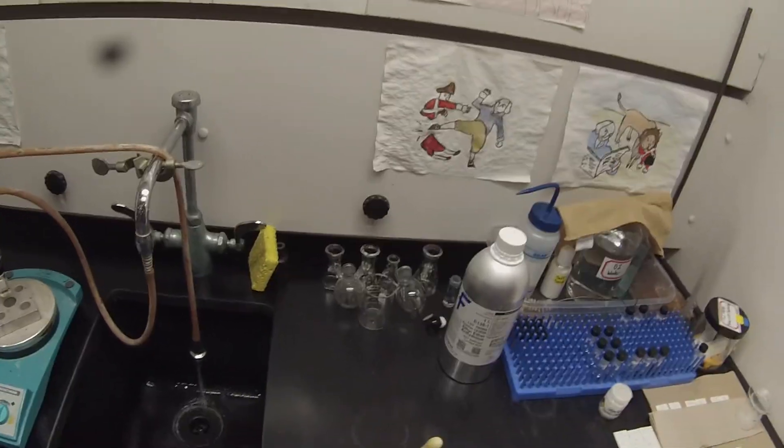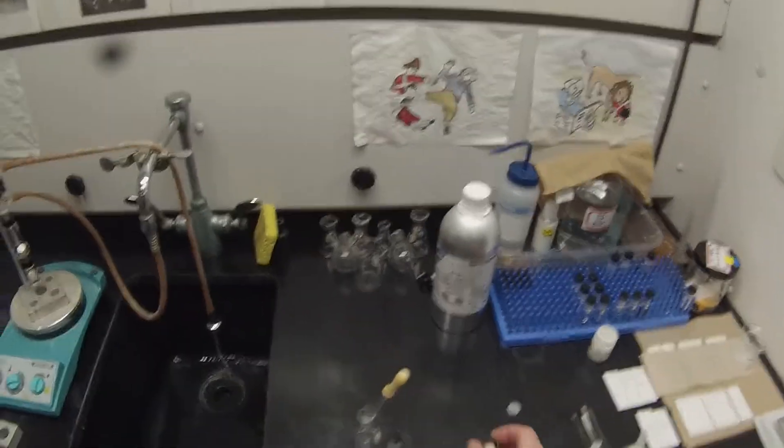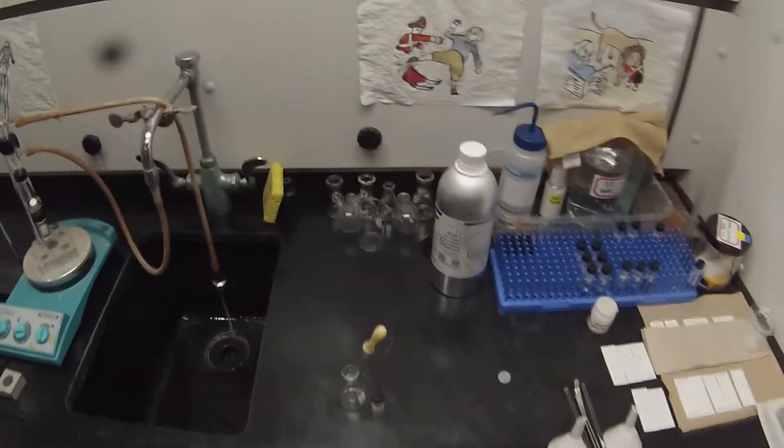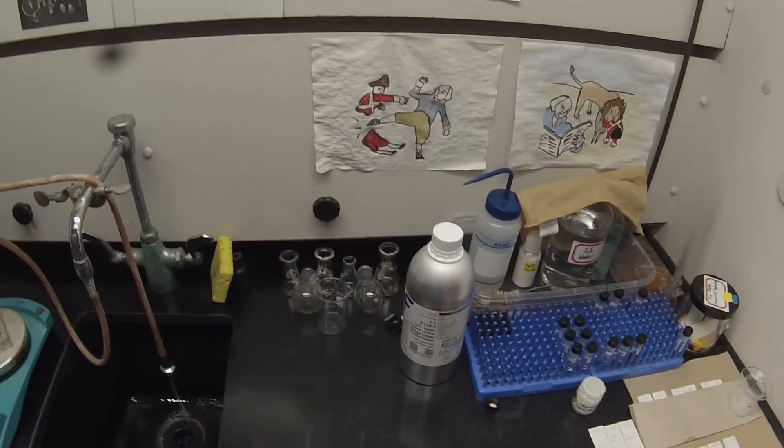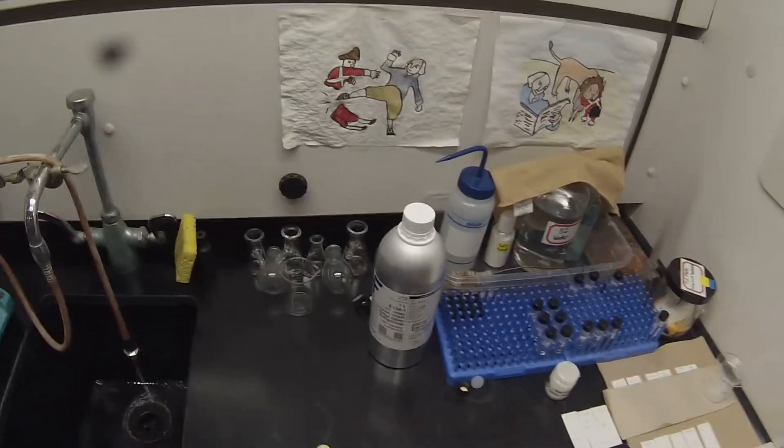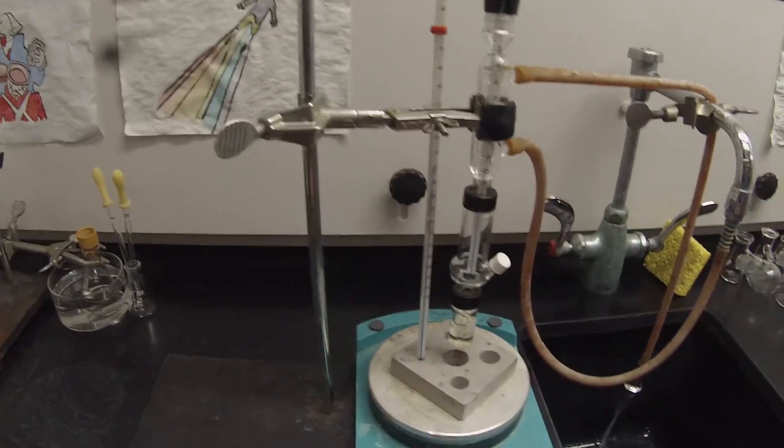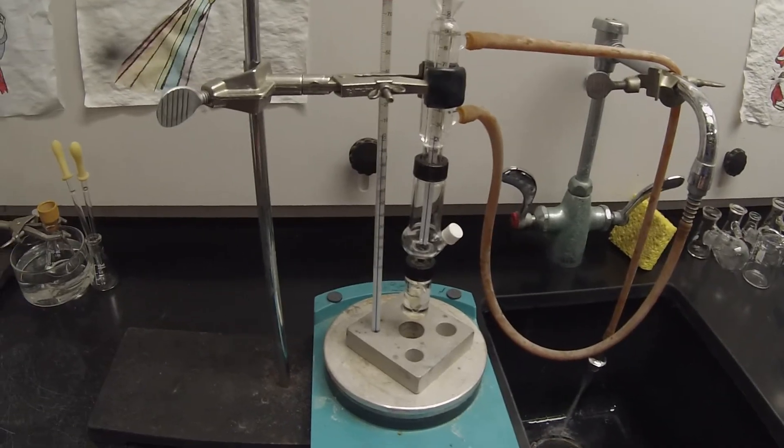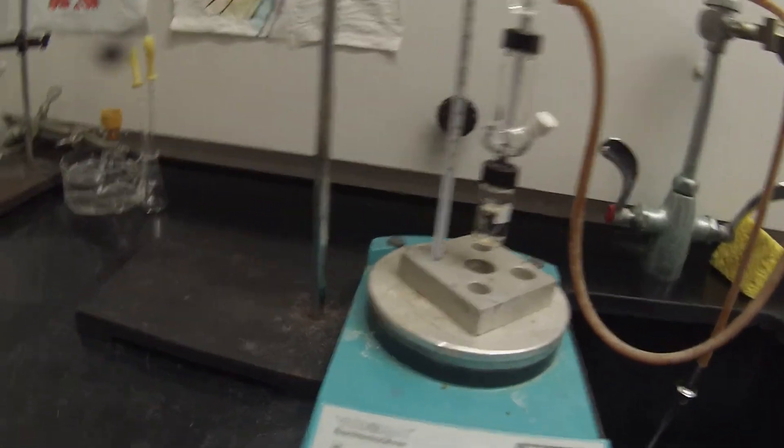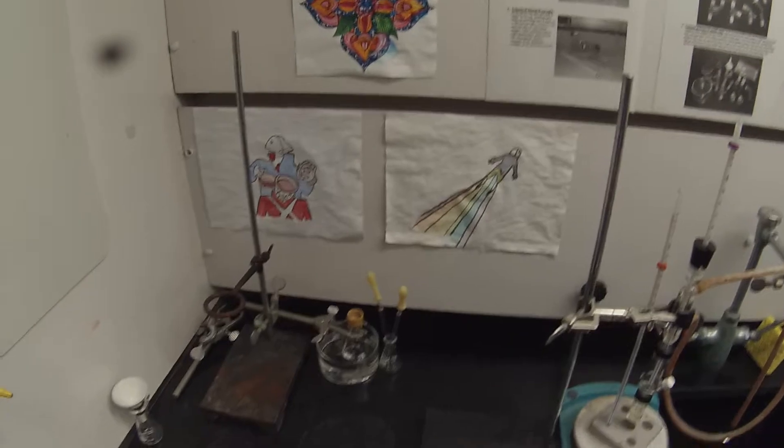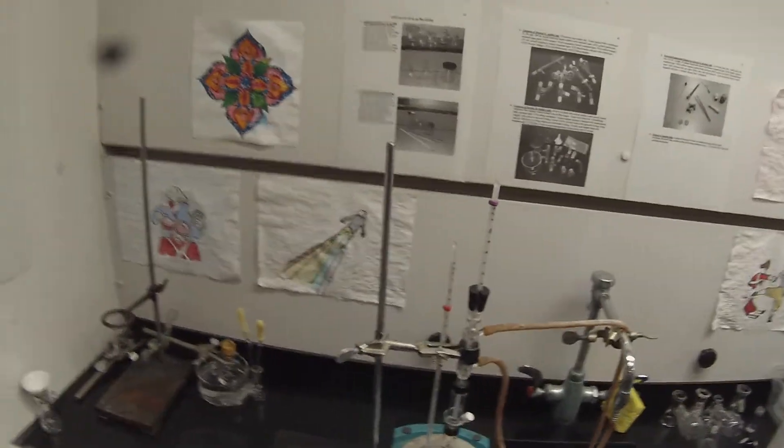These guys still smell like banana. This one doesn't, it's clean, I can put that away. There are a lot more centrifuge tube caps than there are centrifuge tubes in this lab because we're pretty good at breaking them. At least pretty close to colorless, which is good. The residue that remains in there will not be colorless. That is likely to go fairly dark.